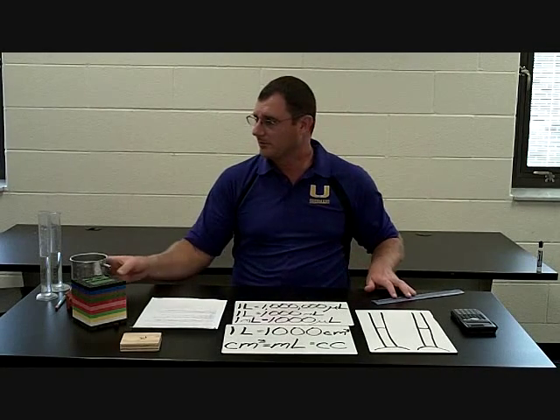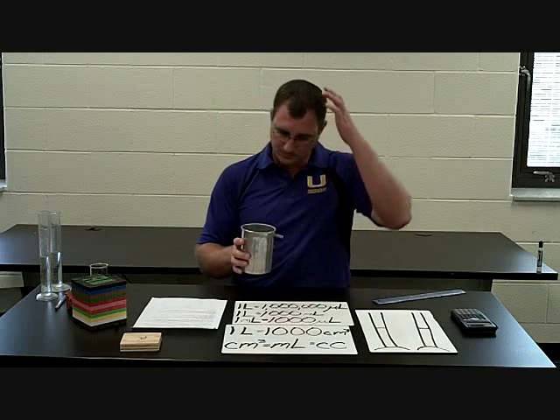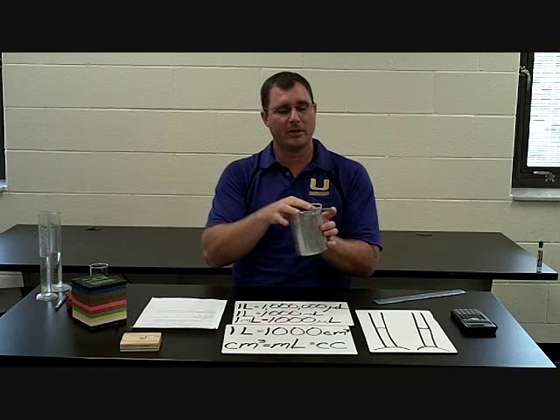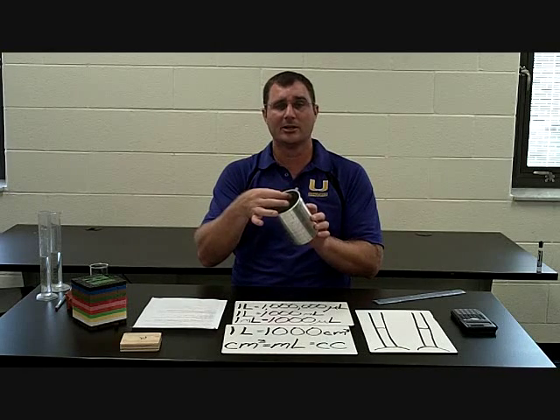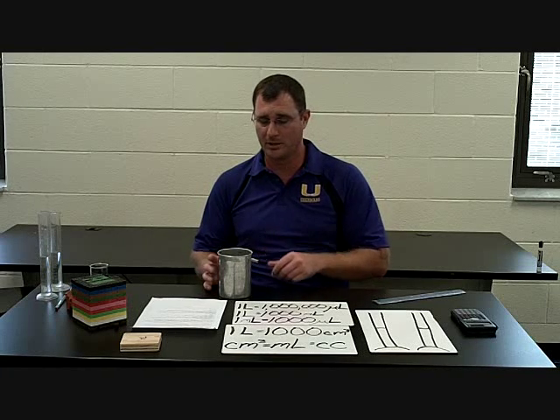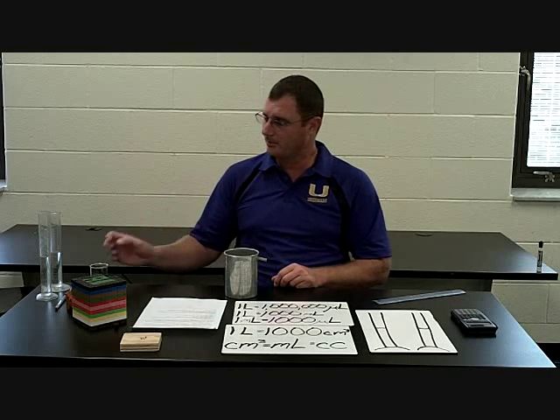For larger irregular objects, what we're going to do is use this overflow can and fill it up with water. I always hold a finger over it — fill it up until it's slightly over the nozzle on the inside. Then you're going to let the water drain out into the sink until no more water is draining. Try not to move it after you do that, because you might splash some extra water out. Once you do that, you're going to put your item into the overflow can, but make sure you have a beaker there to catch the water that comes out.